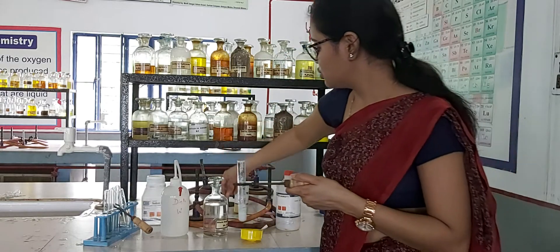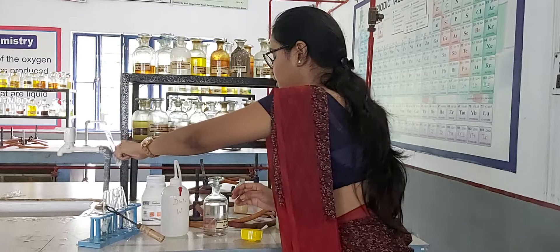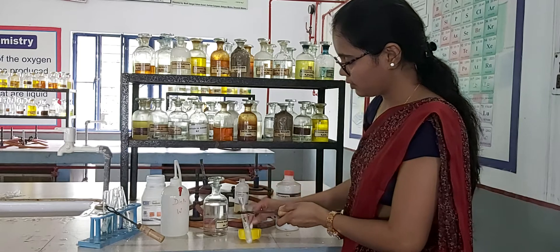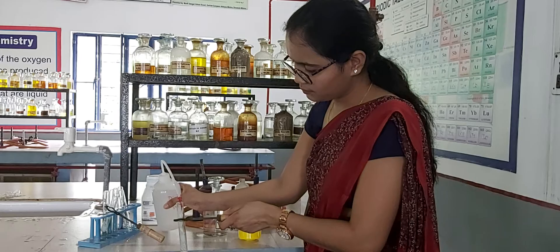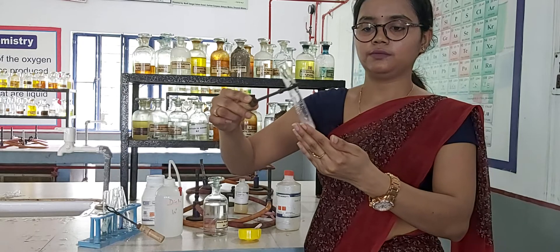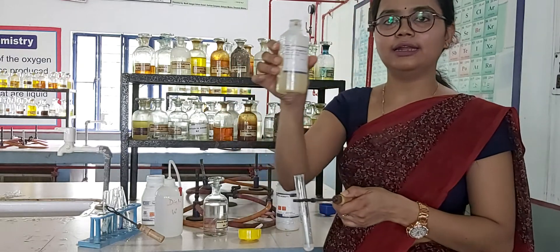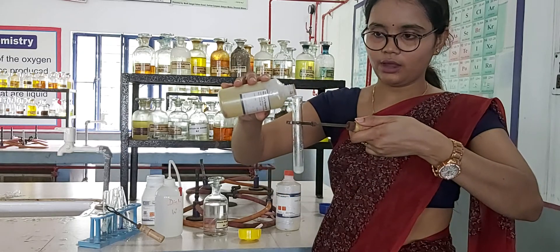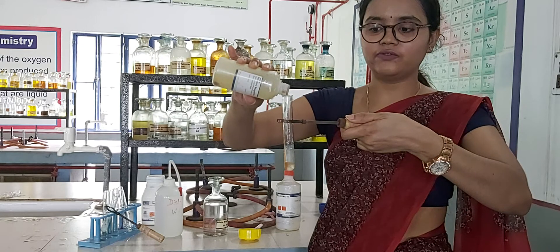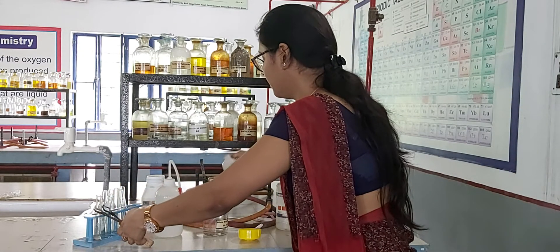We have to do a confirmatory test as well. For the confirmatory test of ammonium ion, we will take a small quantity of the salt again and make the solution again. After making the solution, you will add Nessler's reagent. If you get a brown precipitate after adding Nessler's reagent, this confirms the presence of ammonium ion. As you can see, we are getting the brown precipitate here.